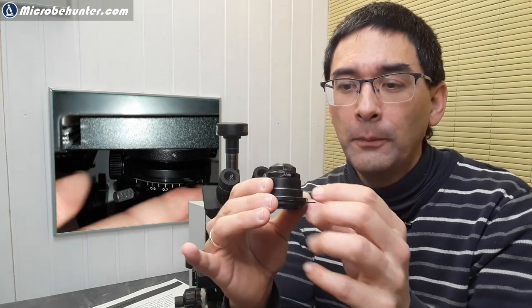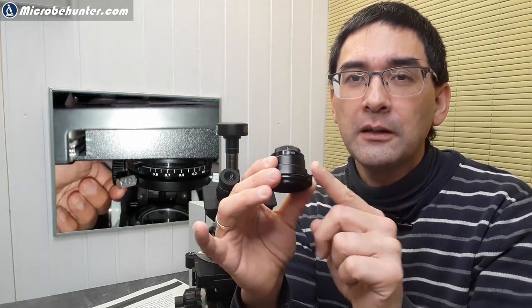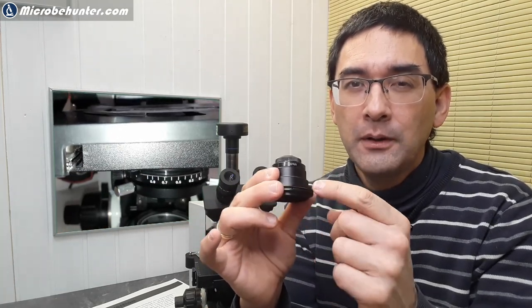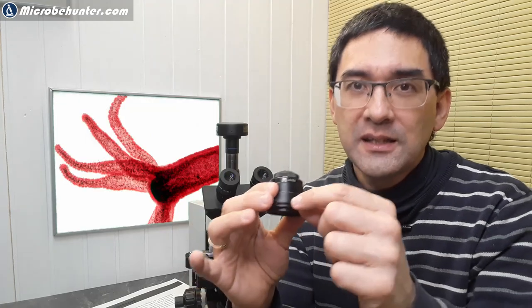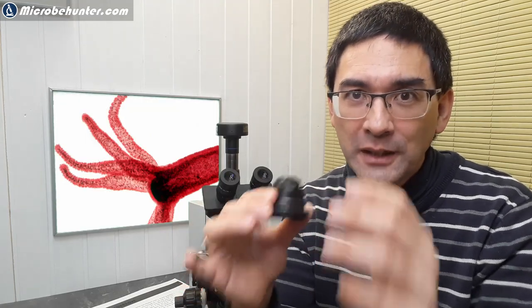But generally you leave it at the top. And this here, the opening and closing of the condenser aperture diaphragm, which I said is not focusing, that is something that I'm going to be talking about right now in this video.